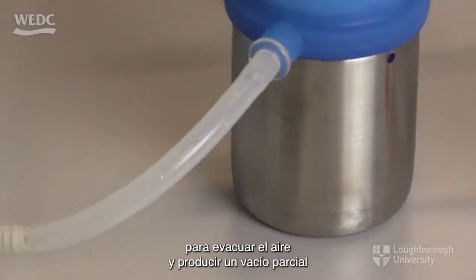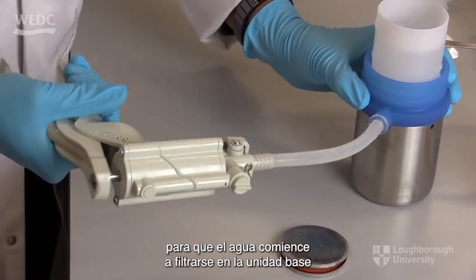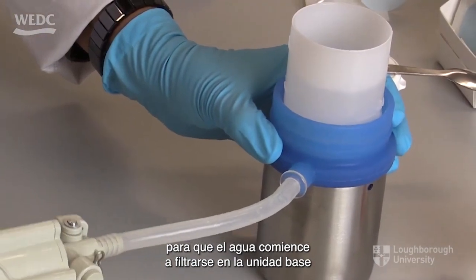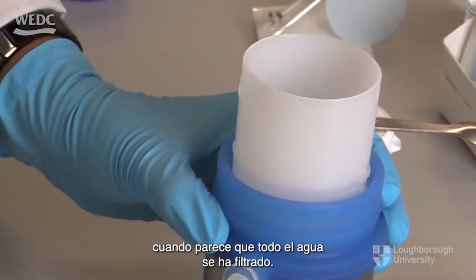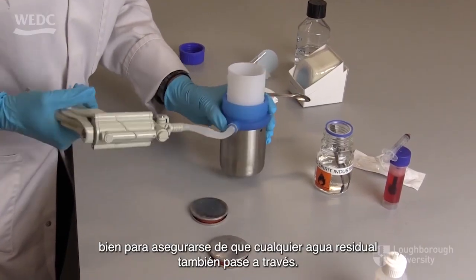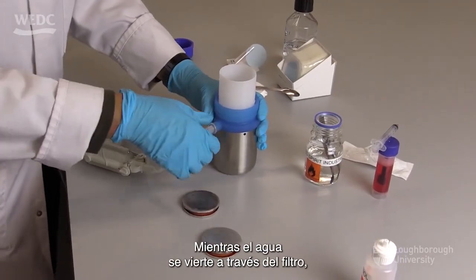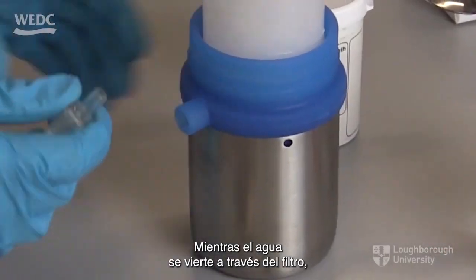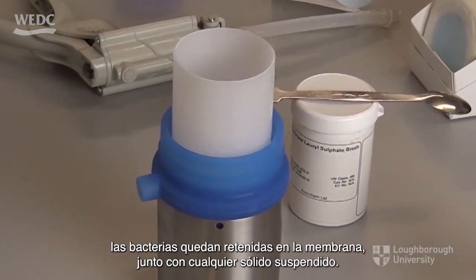By attaching the hand pump, air is evacuated to produce a partial vacuum, so that the water starts to filter into the base unit. When all the water appears to have been filtered, the unit should be shaken well to ensure that any residual water also passes through. As the water sample is poured through the filter, the bacteria are retained on the membrane along with any suspended solids.